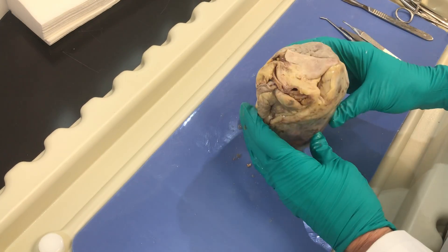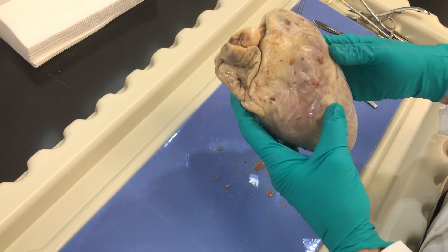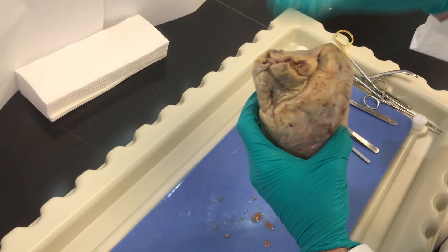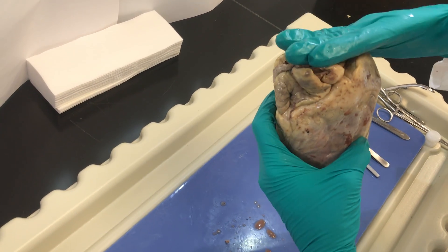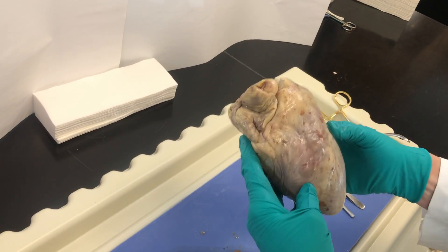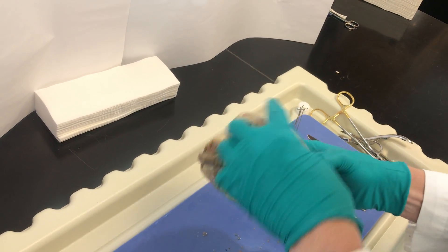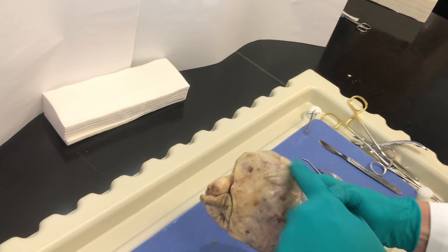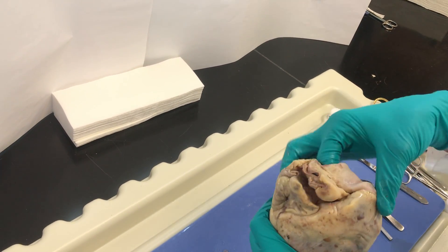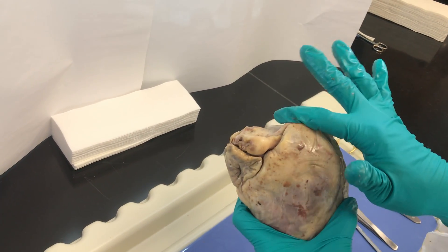Externally, how I orient myself is first I want to look for the apex and the base. The apex is the point of the heart and the base is this flatter part. This is the superior portion of the heart, and then this is going to be the inferior portion. Additionally, I'm going to look for the interventricular vessels right here, and also something called the pulmonary trunk — this vessel right here which comes out the top, coming from the right ventricle.